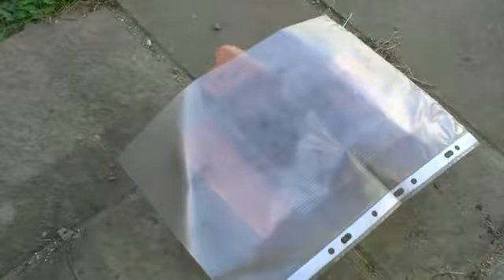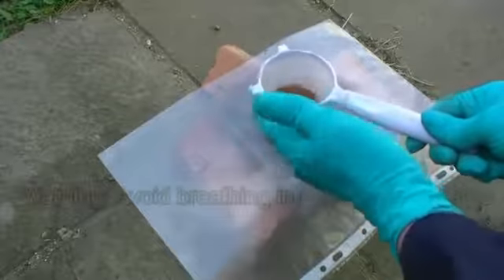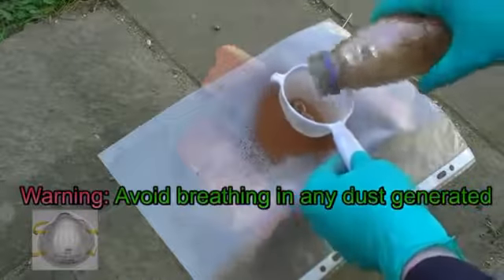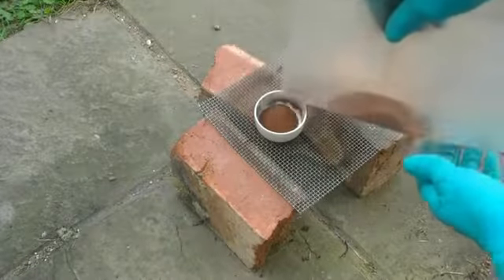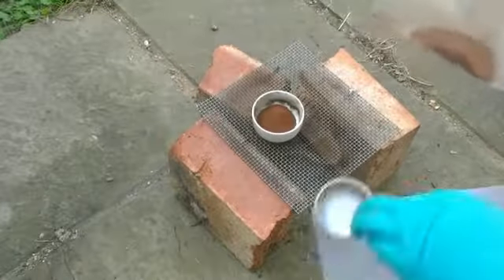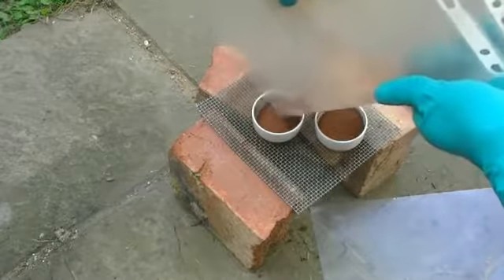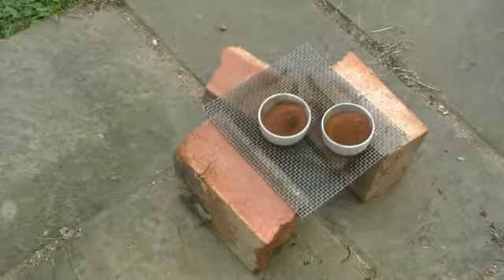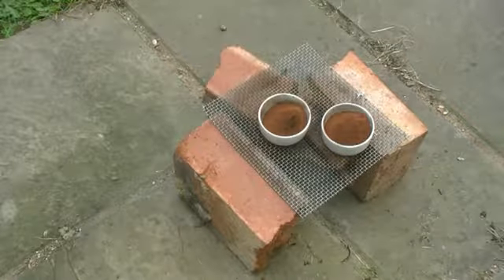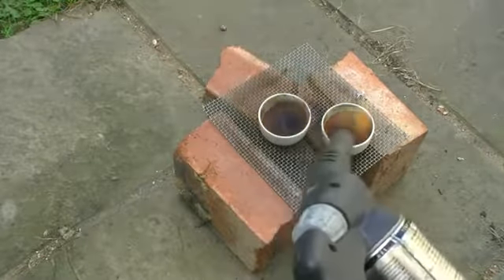To fully oxidize our copper to copper 2+, its highest oxidation state, we're going to roast in air. We're going to sieve our powder to remove any large agglomerates and provide us a fine powder ideal for roasting. We then add our sieved powder to some clean, heat-resistant ceramic dishes. We then roast our powder using a gas torch, and over time we'll see our powder go black in colour as it's absorbing oxygen and converting to the highest oxidation state of copper, 2+.